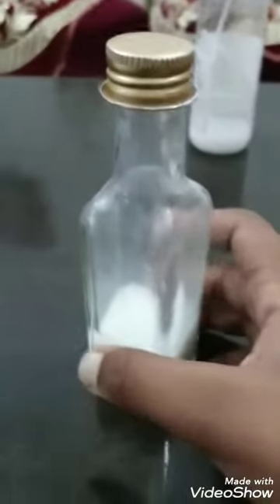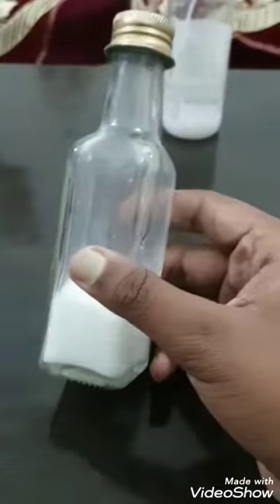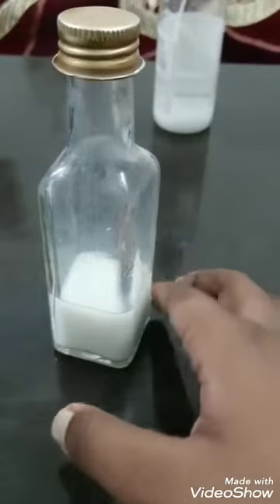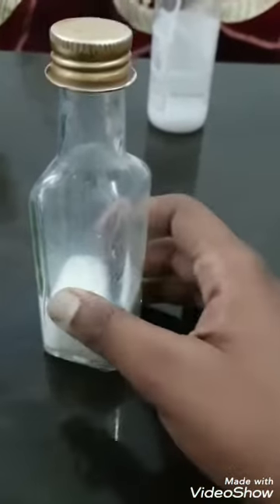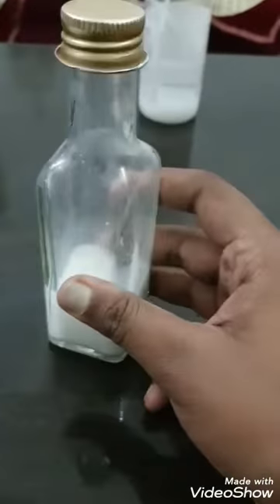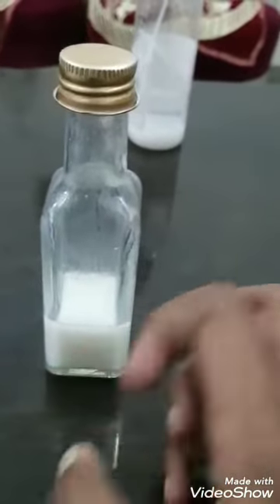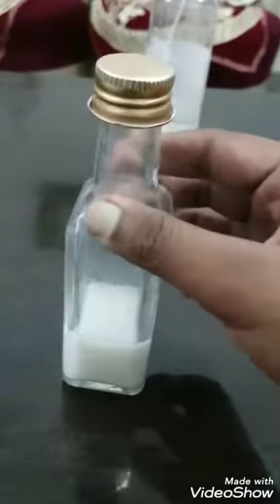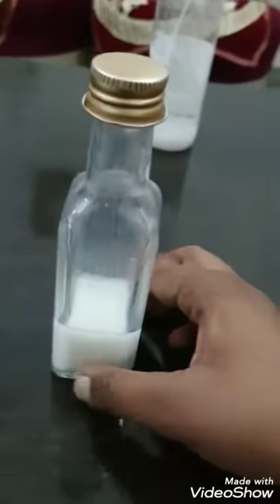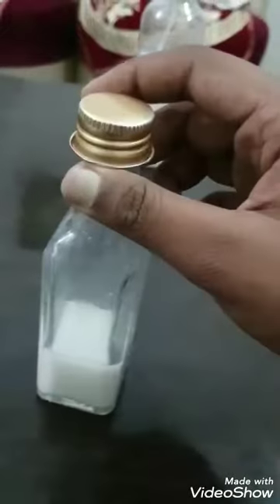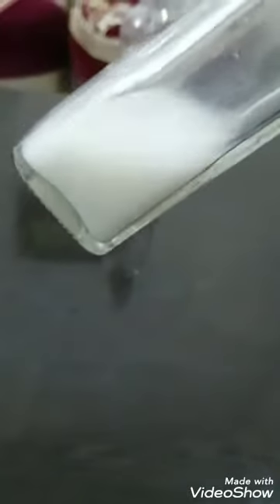Let me clear the fact that even if you leave it for over 12 hours, the reaction will still be continuing because the leftover alum doesn't immediately react. It's going to be a lot more beneficial if you do the reaction in boiling hot water. You're going to get the reaction in about five hours. I really recommend you dip it under hot water for much efficiency.